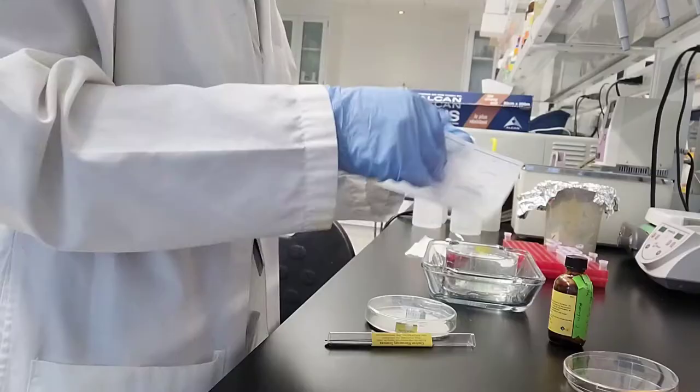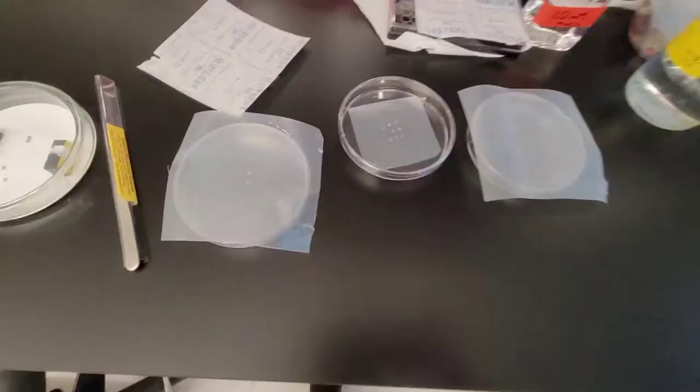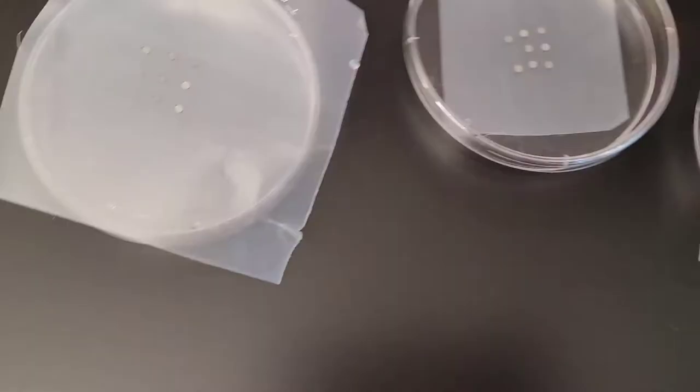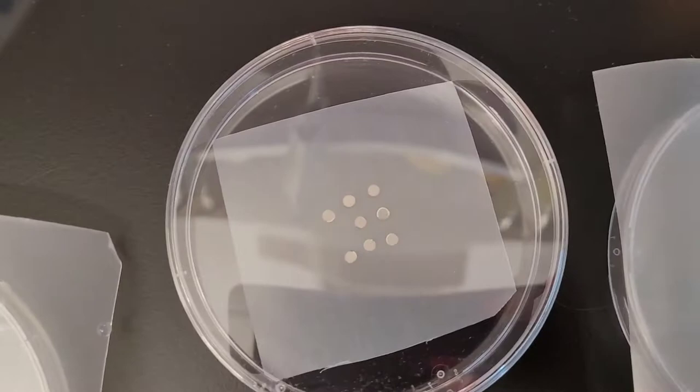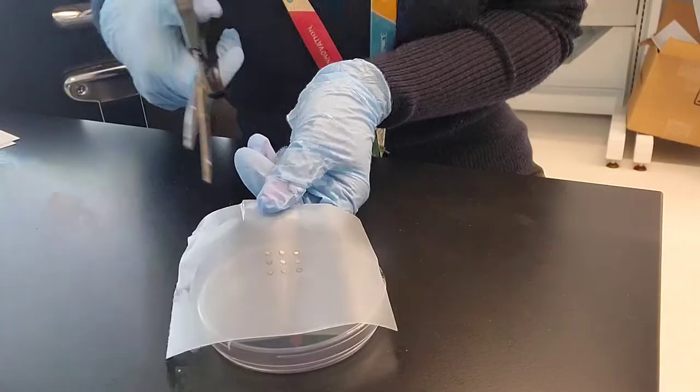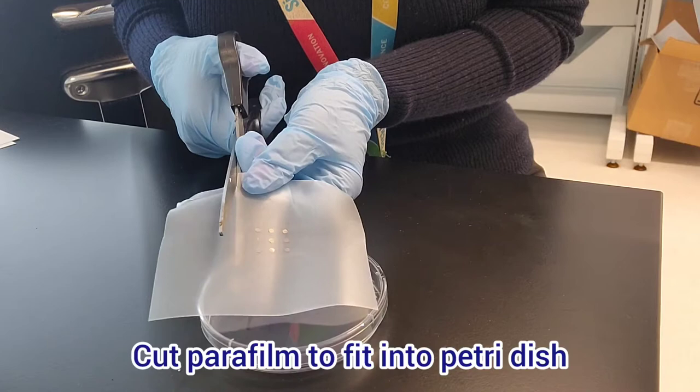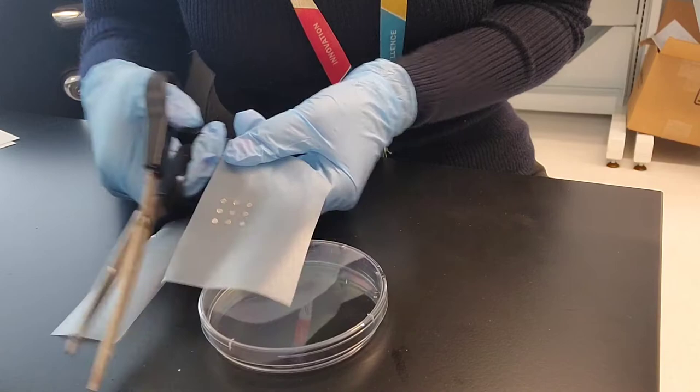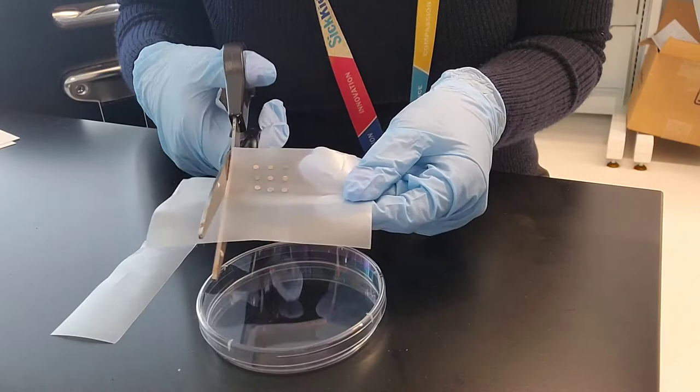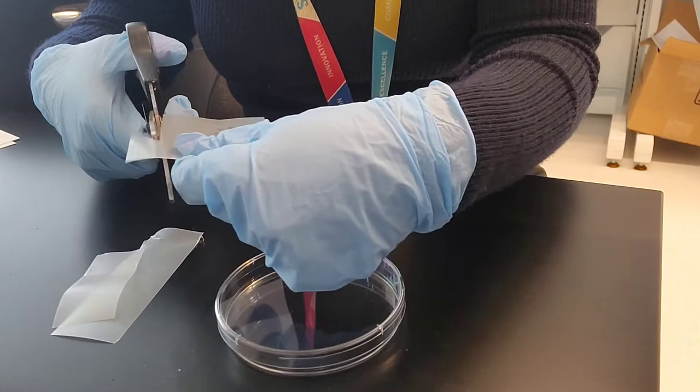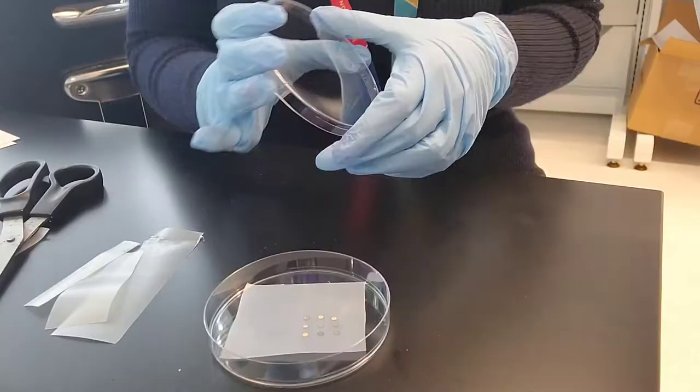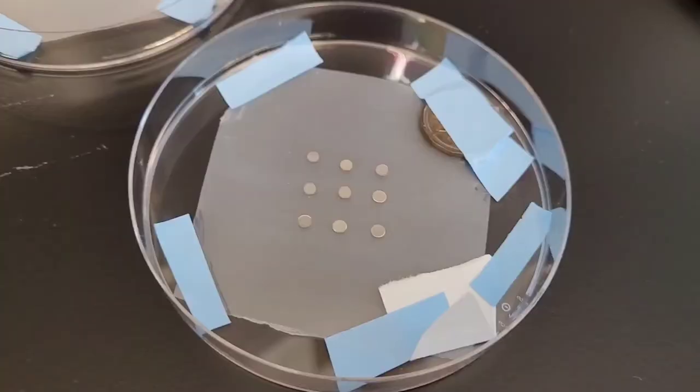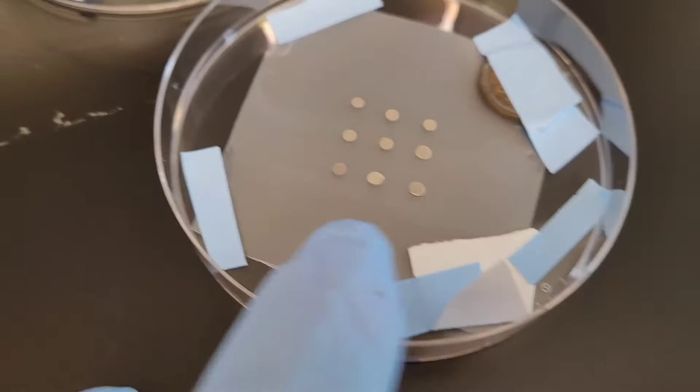These are just how the grids look. Now I'm repeating the process so that I'll have three sets of prepared grids that are ready to be carbon coated. This is good practice just in case something goes wrong, because the carbon coating process is sometimes not too accurate. In case there is a larger than expected deposit of carbon or some grids flying off for some reason, it's better to have an extra preparation so that you don't have to come back and repeat this whole process.